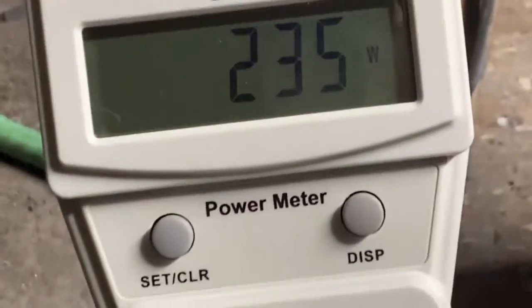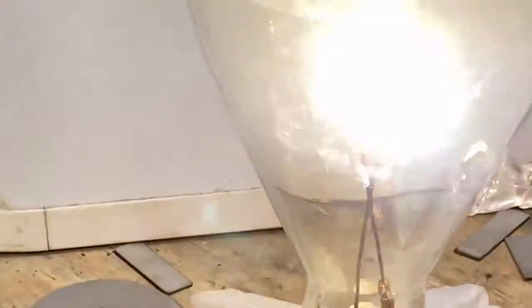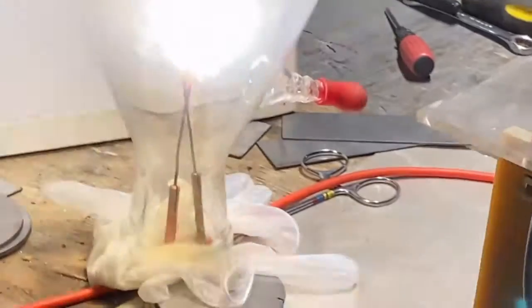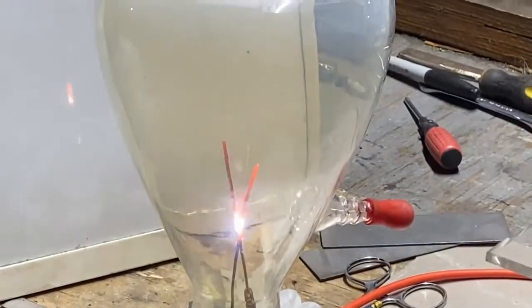Let's try and turn it up more — that's really powerful there. I don't know if this is sustainable. Look at them rods, those babies are screaming. That is a hot arc, I can hear it whistle. We certainly don't want it to keep doing that, it'll break the glass and catch everything on fire. I almost bet it's going to smoke this glass out — that white smoke coming off the tungsten rods. I don't know if this is suitable. It's certainly a high temp setup, that's for sure.